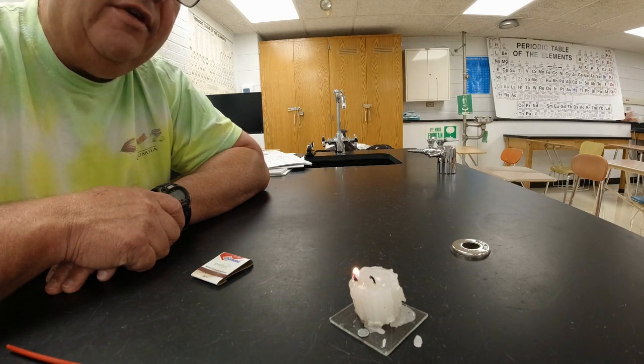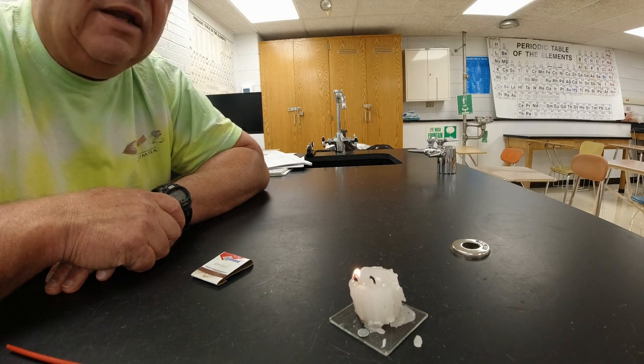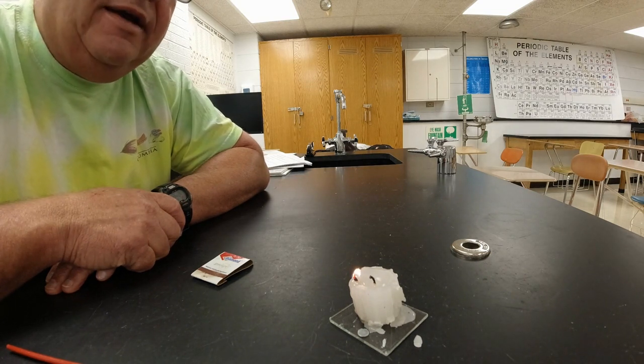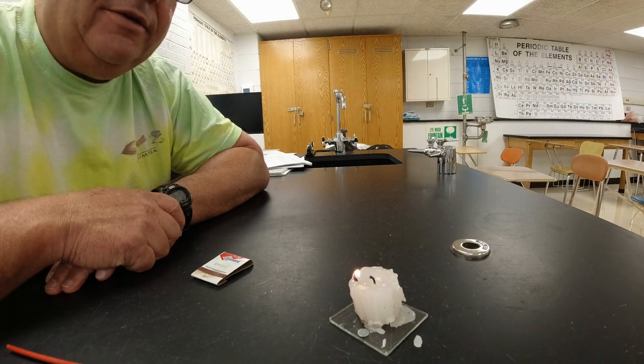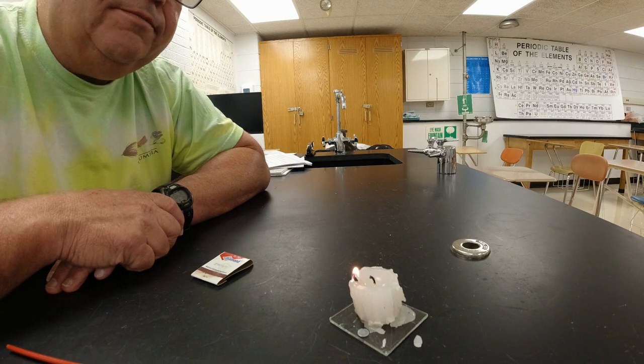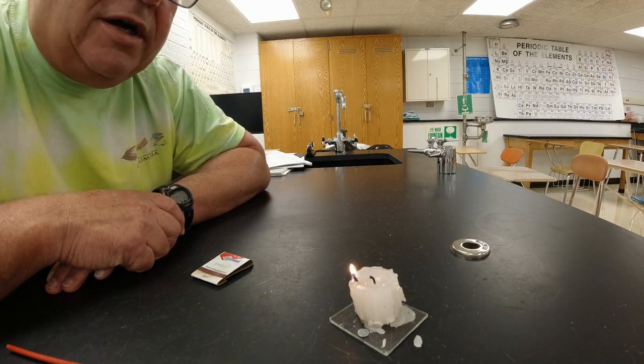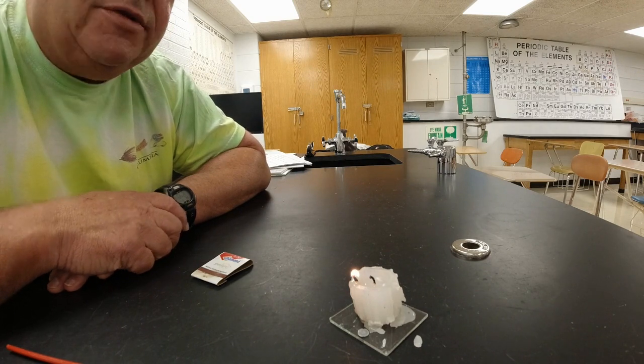But for some reason, that wooden wick does not work nearly as well. And a lot of times when we do this lab, that flame goes out when it gets down to the wax. And it still might do that, I don't know. We'll let it burn down a little bit farther and see what happens. All right, but the flame is much smaller. All right, so we're going to blow this out. If you need to pause, you do that and write down your observations.